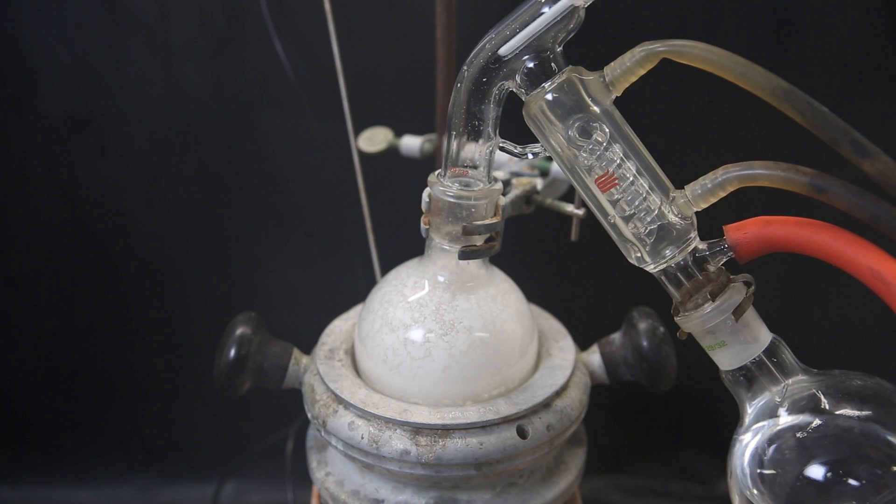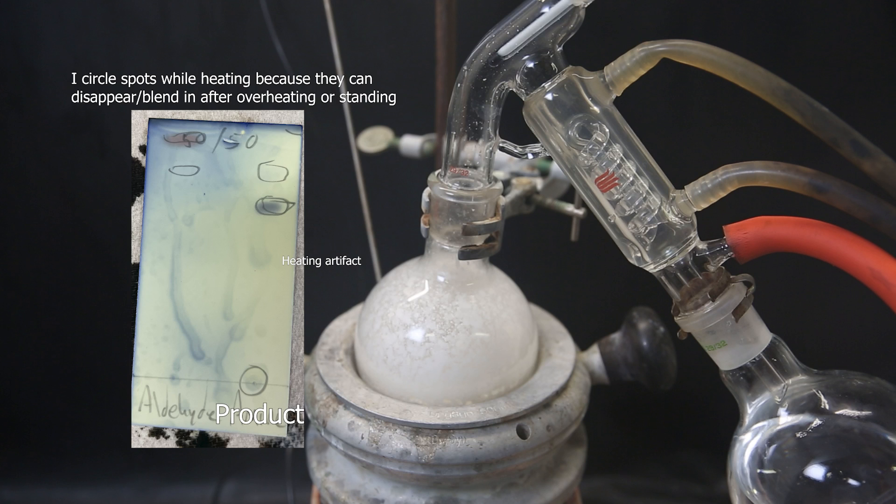Now I have to do the exact same as before, since I will have to do column chromatography again. So I have mixed it with silica gel and ran a TLC on it. I compare it with the starting biphenyl, and we see that it disappeared in the product. But the small impurity is still there. The new amine product is below it, and at the baseline we have the second starting material, alaninamide.